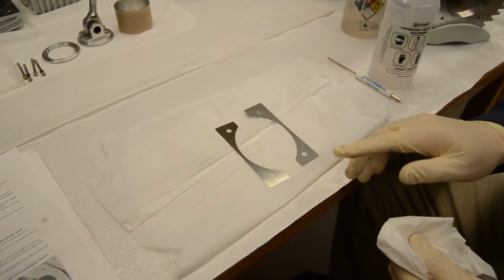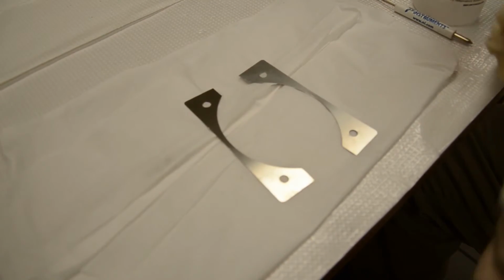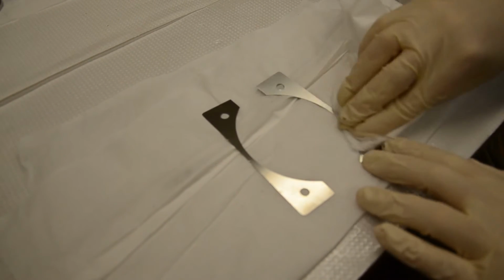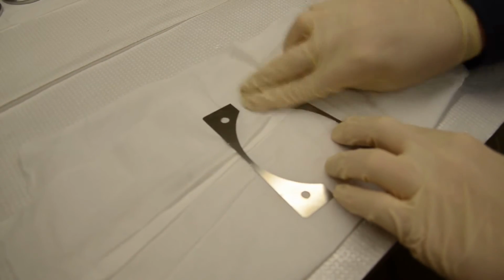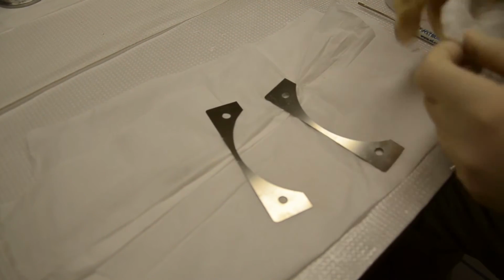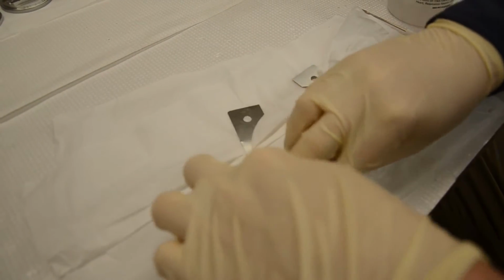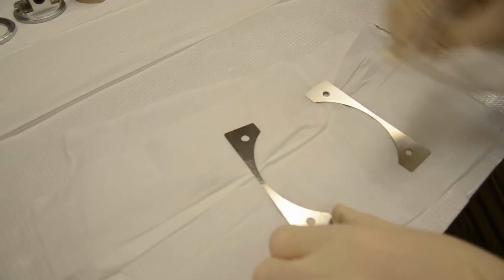Alright, we have the left metal gaskets here. So what we have to do when we clean these is just pay attention to the orientation and clean them gently, once again with alcohol, and just more of a real light cleaning on both sides. They typically do not get very dirty. It's probably the absolute easiest component to clean.